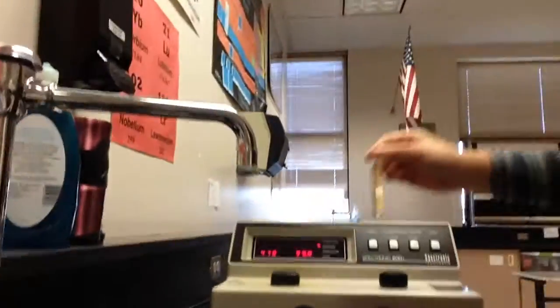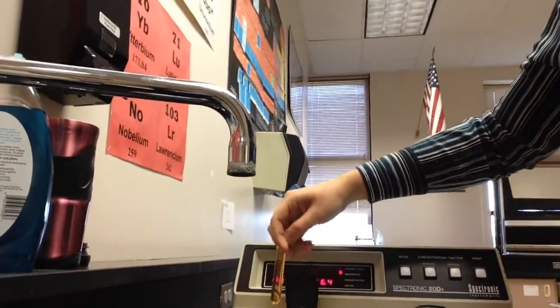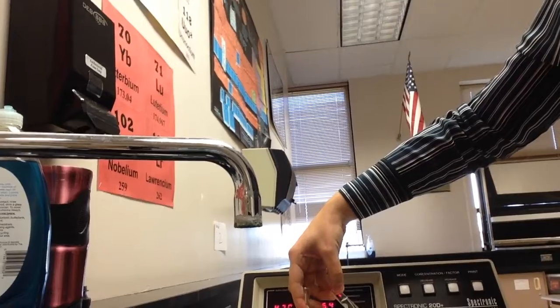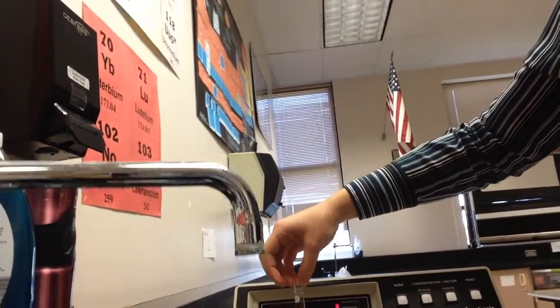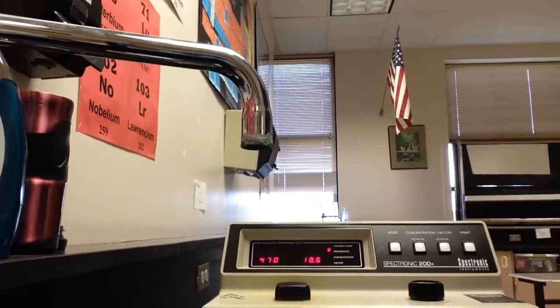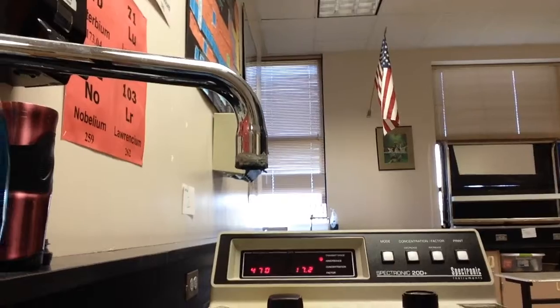So I'm going to walk us over to the spectrophotometer, which is here. I'm going to put it, oops, I don't have enough hands for this. You will have taken your blank out before you started this. And then you put your sample in your spectrophotometer. Looks like that. Close it up. Then you're going to take a reading, this right here, every 30 seconds. Somebody's got to keep an eye on the clock and say 30 seconds, 30 seconds, 30 seconds. And you do that for 5 minutes.